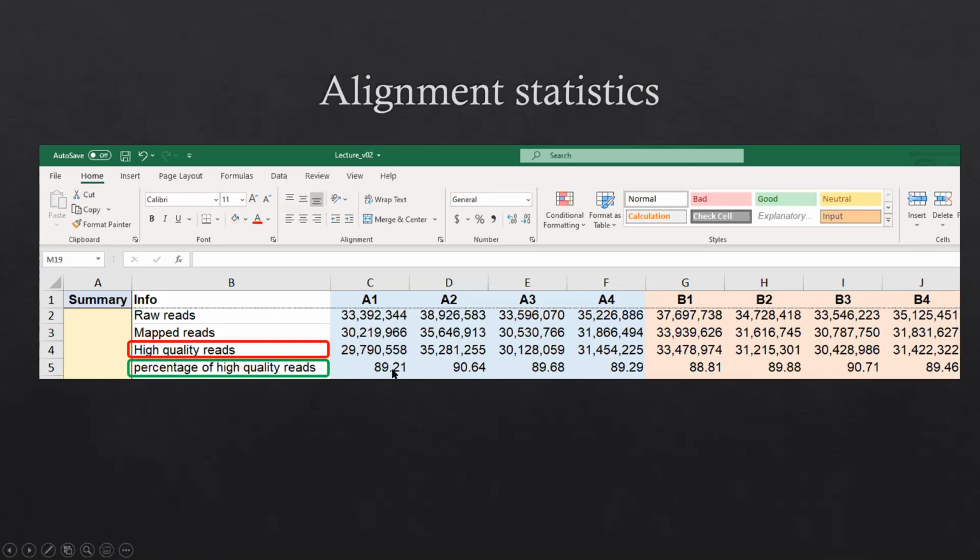This row also shows the percentage of high quality reads. For example, one extreme case is if you sequence one sample with 100 million reads, but you only get 35 million high quality reads, that means the percentage of high quality reads is only 35%. Even if the number of reads that can be used is good, the mapping rate is pretty low. Then you have to go back and check the sample, whether something was wrong there, like possible contamination or some mix up.